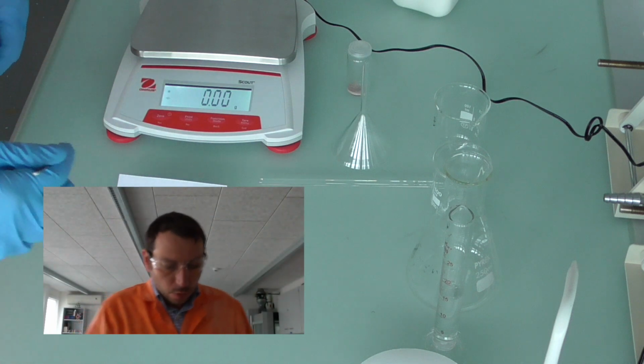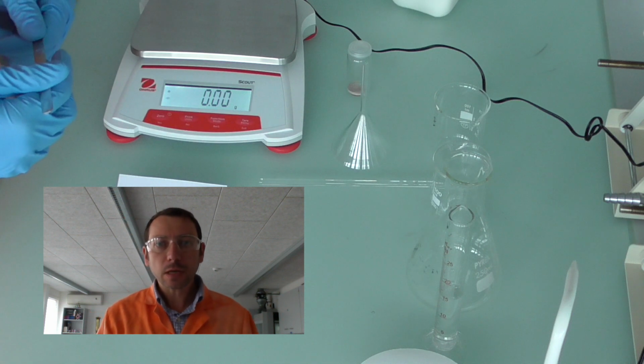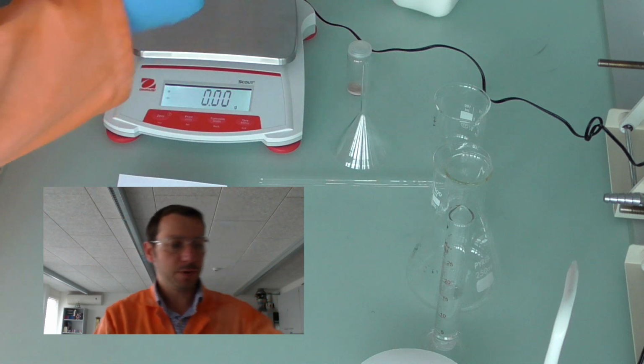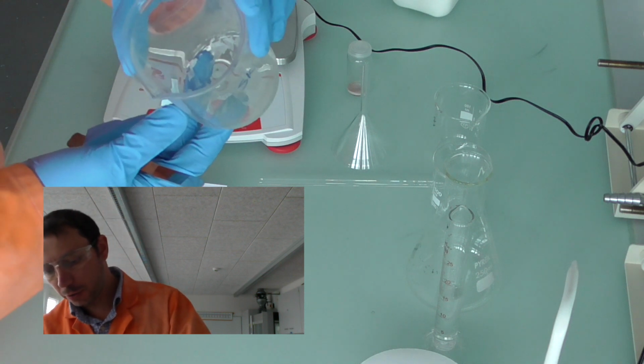Okay, so what I want to do today is show you the experiment that I would like you to carry out when you get onto campus. In the experiment you're going to use the silver nitrate if you prepared it in the last lab, and here is a sample of silver nitrate. The crystals are formed in the bottom, and hopefully you'll be able to use that.